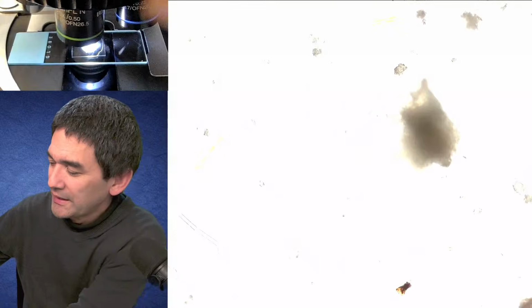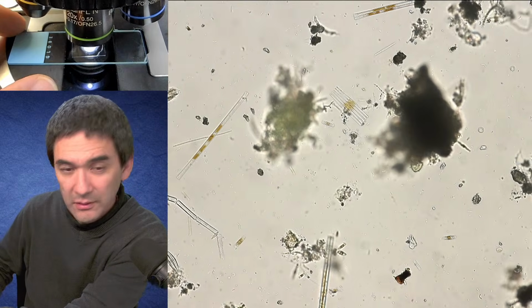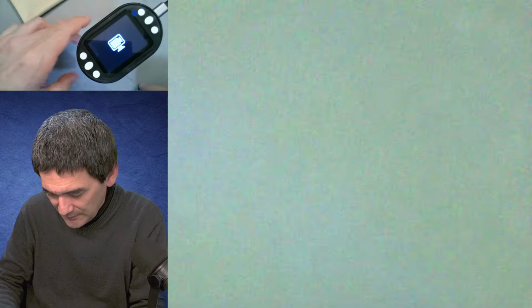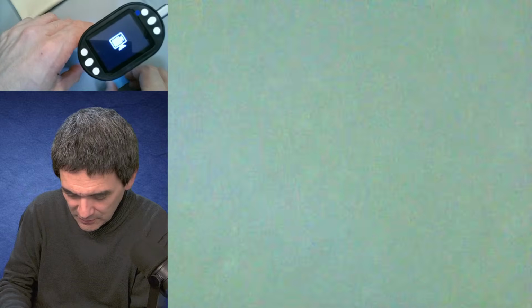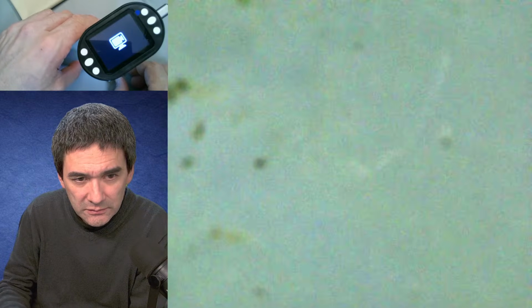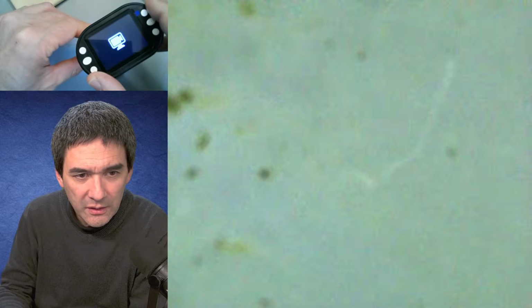You probably have already guessed, maybe not. So here we go. Let's put this away. Here we are again, and we insert it down here. This is going. Here we go. I have to focus a little bit.